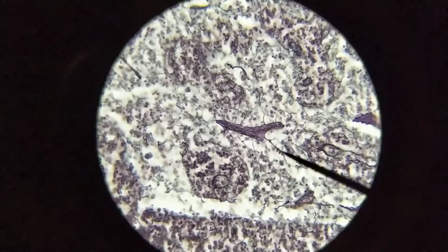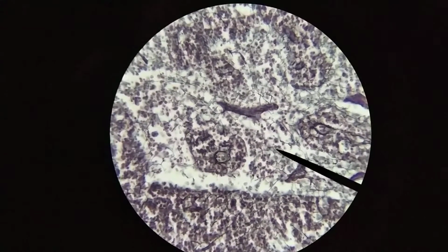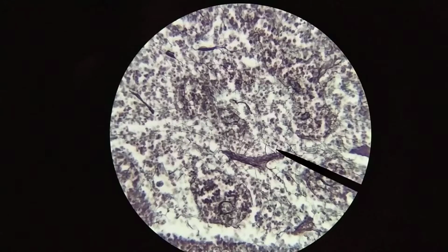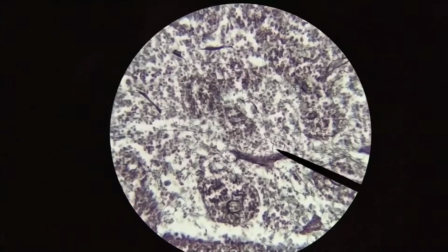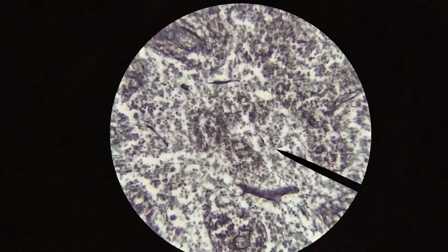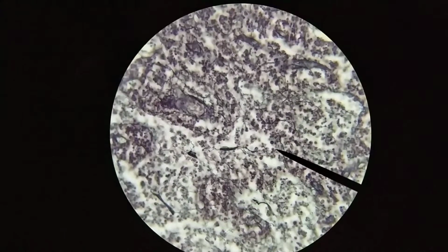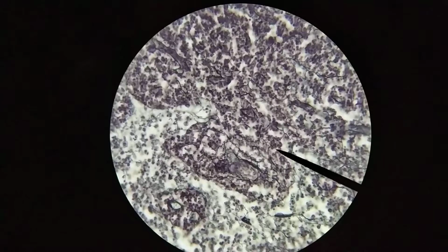Okay, so let's put this into focus, and this is where you see the reticular fibers here. All these very fine looking threads that you're seeing here throughout all this. Okay, very highly branched. Okay, very delicate looking. Those are reticular fibers. And so again, they form a network on which all the other cells sit. It's kind of like a mesh.